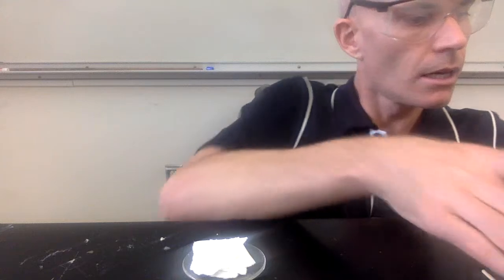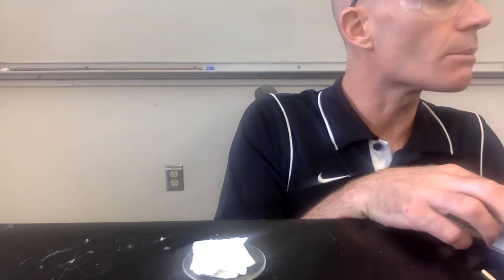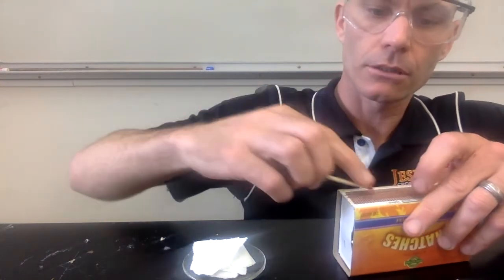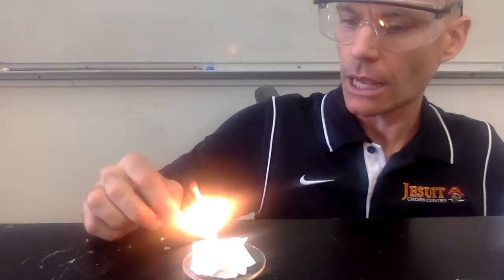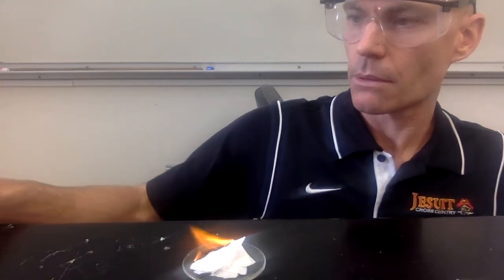All right, I'm going to set the paper here on a watch glass, and then we're going to use that for investigation number 2. And so for investigation number 2, I'm going to take that piece of paper, I'm going to take a match, and I'm going to light the paper with the match, and we'll let it burn.